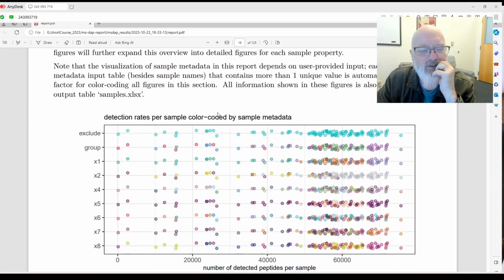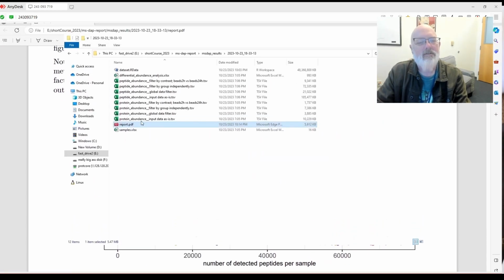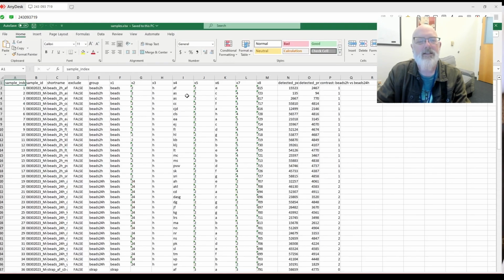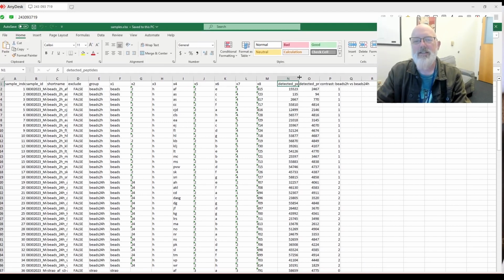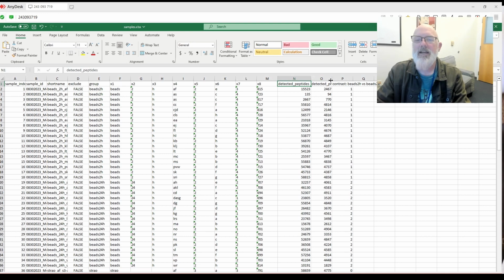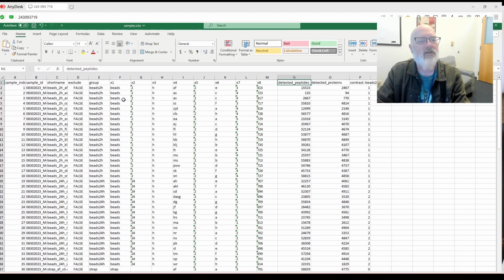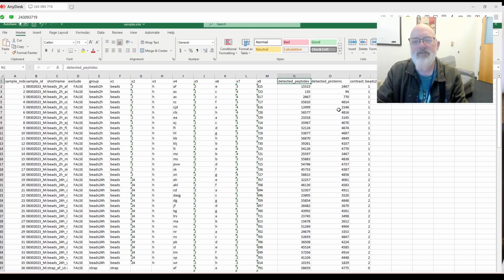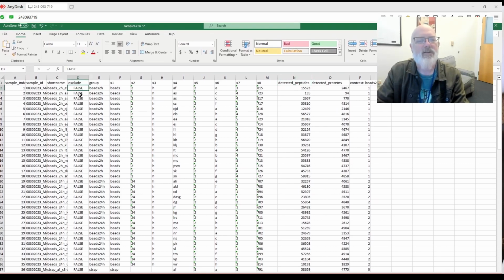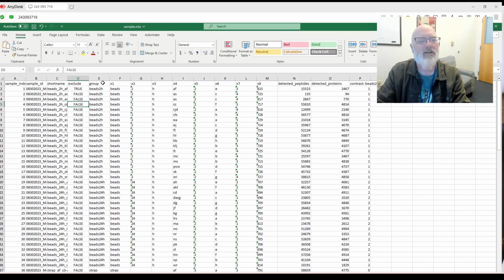This one is a little confusing. So you remember when we had our sample metadata, and I was like, what the heck are all these extra columns here? For example, X1, X2, X3, X4, which it tried to parse from our file name. Oh, and you can see now it's put in the number of peptides, number of proteins, and you can filter by those in order to exclude them. You could just make a little algorithm that says below whatever 2 standard deviations away, exclude it, or if you have some other mechanism to exclude it, and you would just change this to true and rerun your analysis.